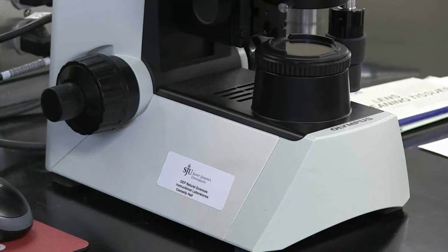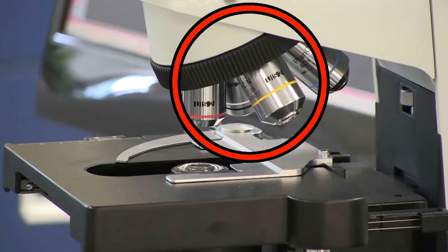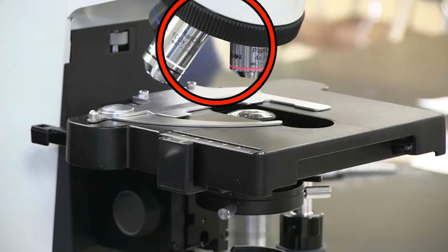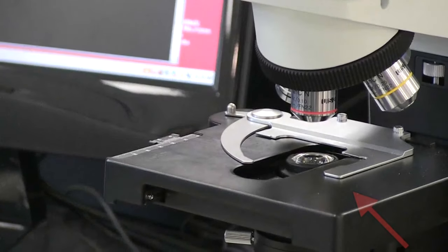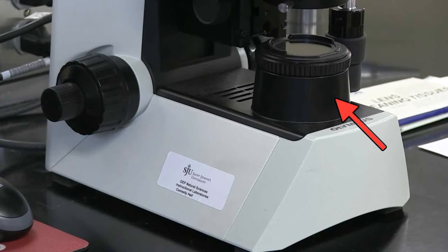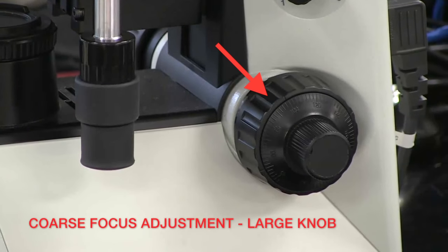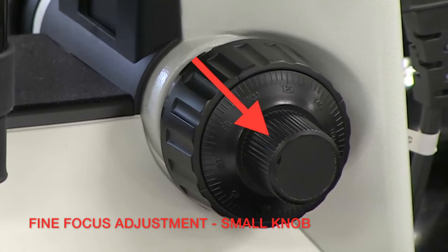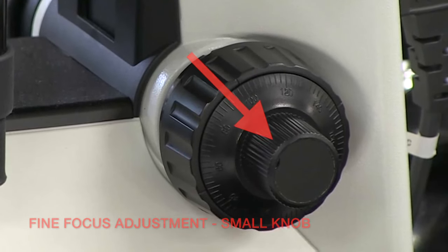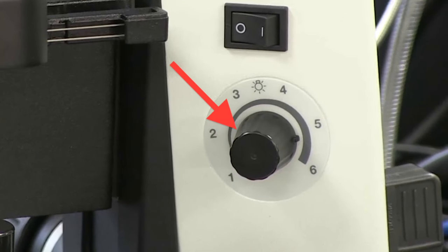The parts of the microscope include the following: the ocular eyepiece, the objectives which contain lenses, the mechanical stage control, the illuminator, the coarse focus adjustment knob, the fine focus adjustment knob, the on/off switch, and a knob that controls the intensity of light.